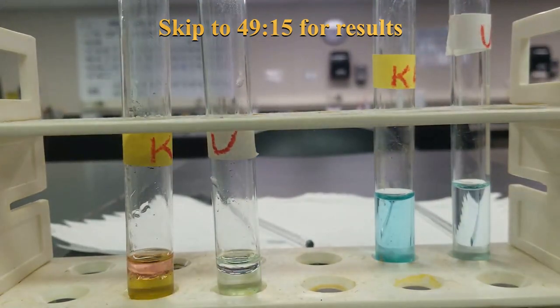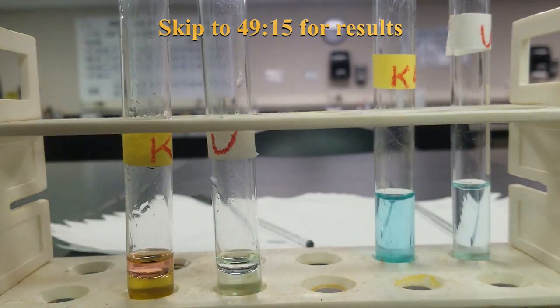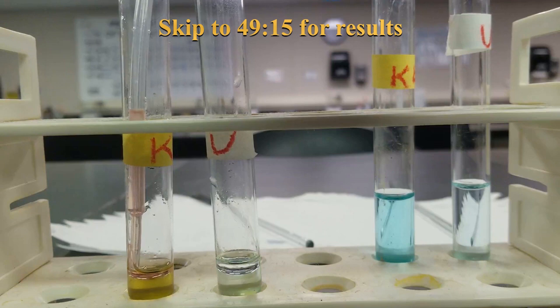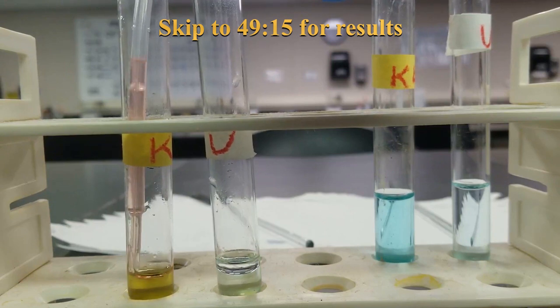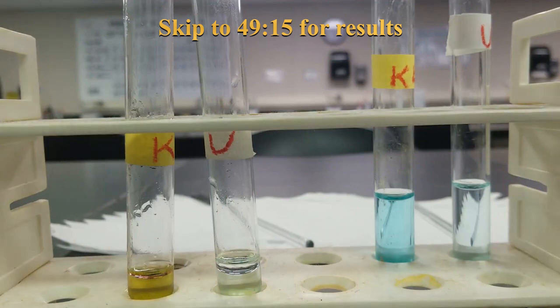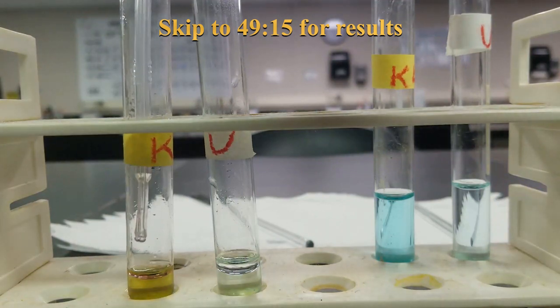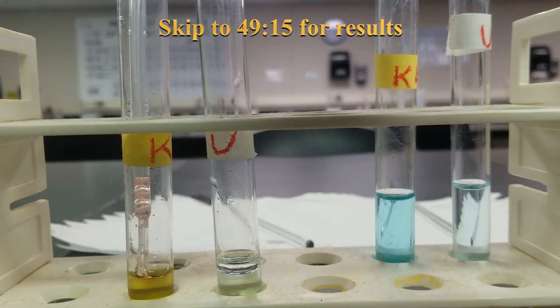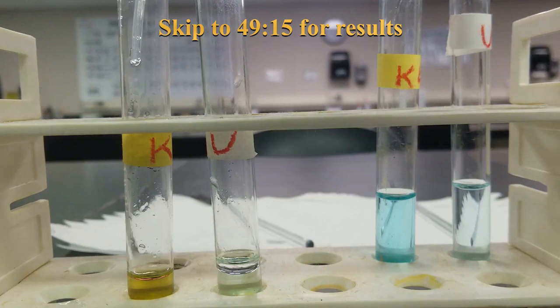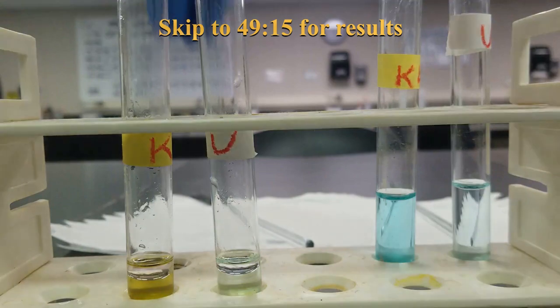Let's go ahead and pipette this out, and hopefully that'll be the last one. Add some more toluene. Agitate.